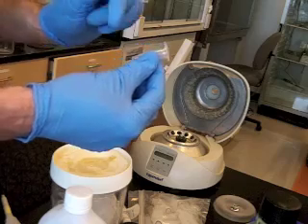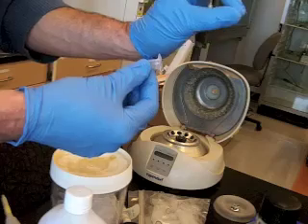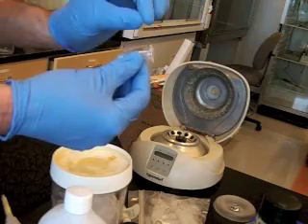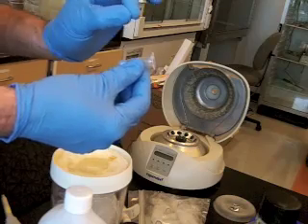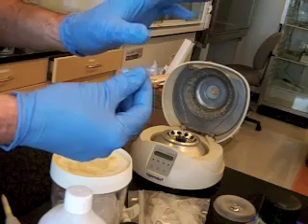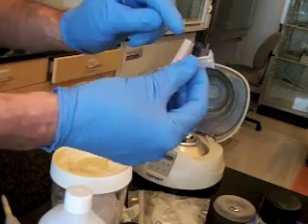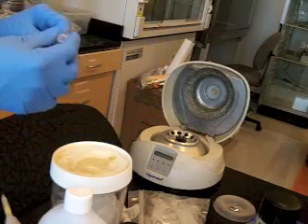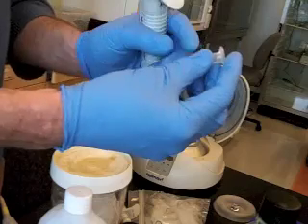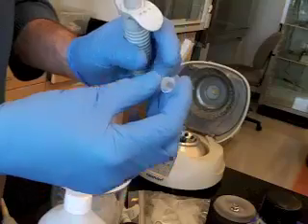So sometimes it's cellular debris, and we're going to pull the liquid off and save the clean liquid away from the debris. Other times it's a DNA that we precipitated, and it's in a pellet. We're going to get the liquid off and discard the liquid. After centrifuging, we talk about the pellet, and then the liquid is referred to as a supernatant. And the reason we put the hinges out is because sometimes the pellets are really small, and we want to avoid them when we're taking off the liquid.